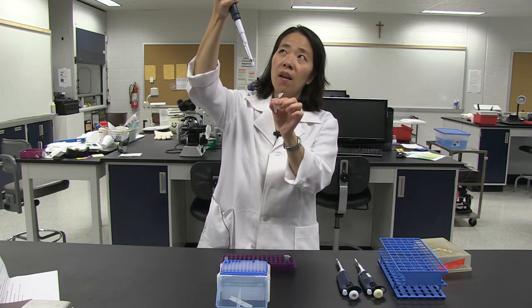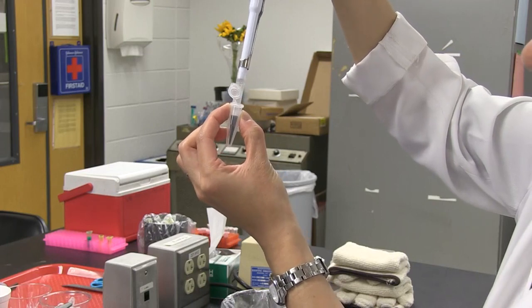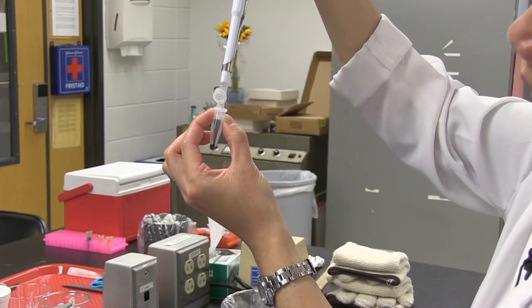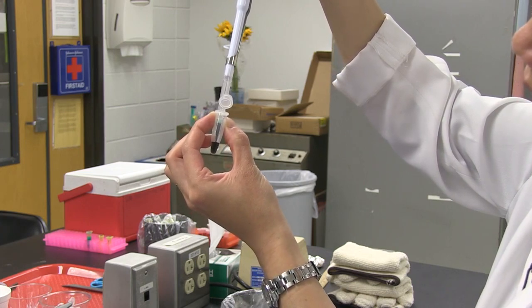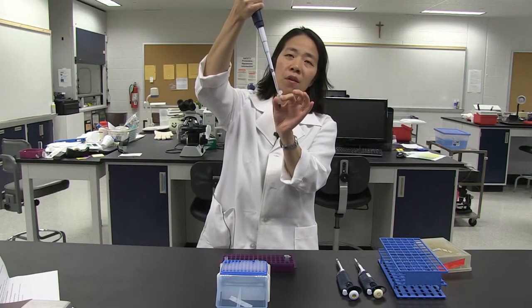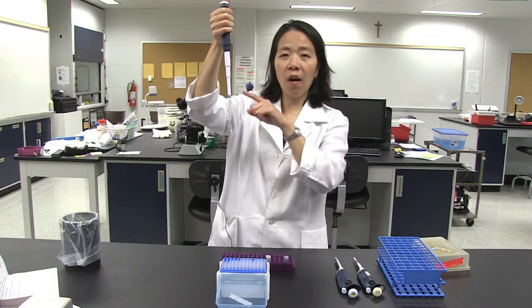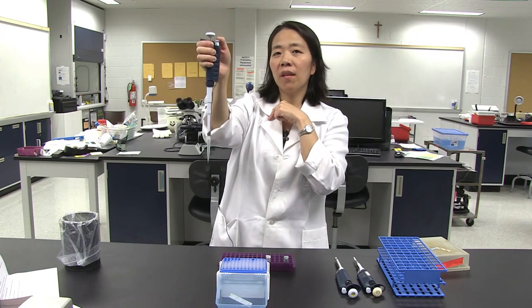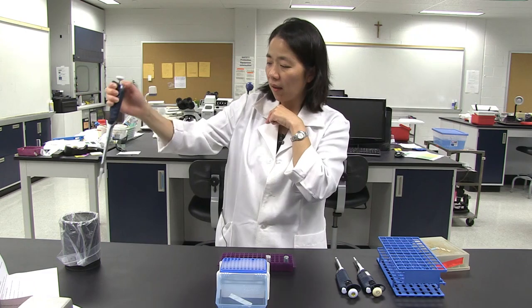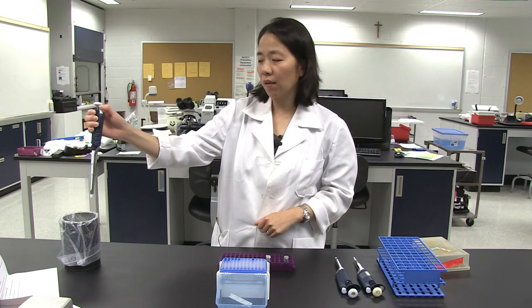Here's my empty tube that I'm going to dispense this liquid into. Take the tip and go all the way down to the bottom, then dispense. Let the plunger go to the first stop, wait a little bit, and then go down past that first stop. While still holding the plunger with your thumb, come out of the tube and then let go of the plunger. To discard the tip, you can either pull it off with your finger or press the ejector button and aim your tip into a disposable container and press down to eject.